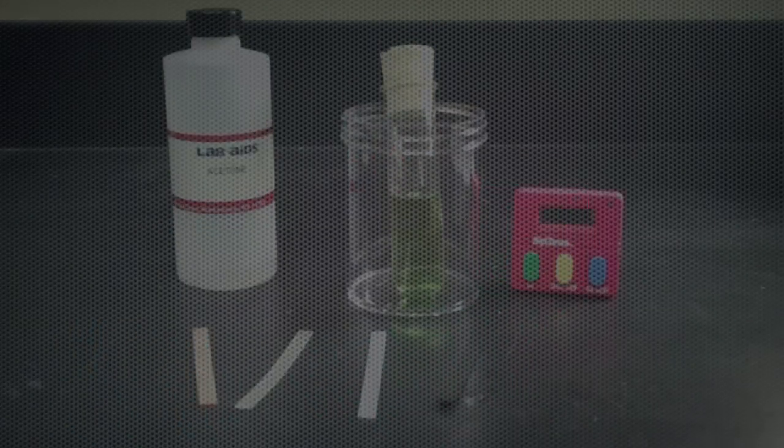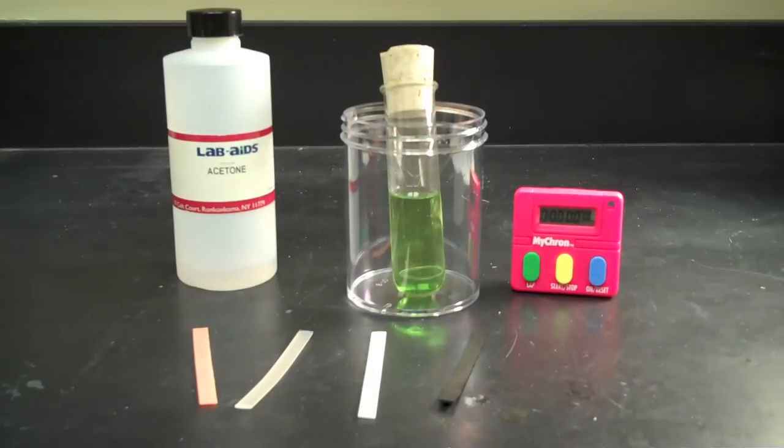We will now conduct the same acetone test with the unknown plastic strips. First, let's look at their characteristics.